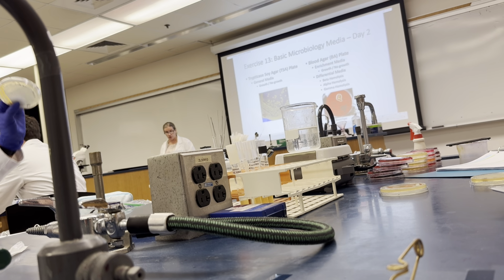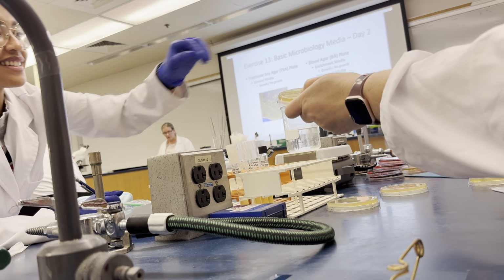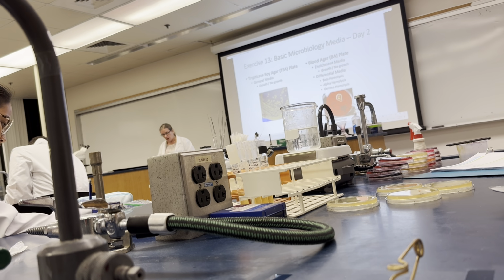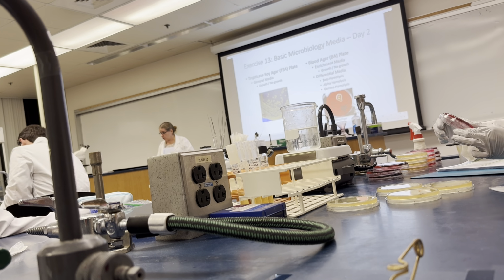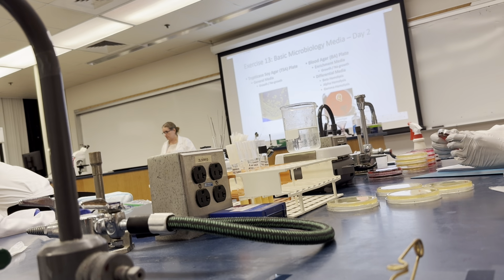Well, they grew, so they're live cultures that are able to utilize the nutrients on trypticase soy agar. Something along those lines. Where are we putting the interpretation? That they're live cultures that can utilize the nutrients in that general media. They can grow on TSA.